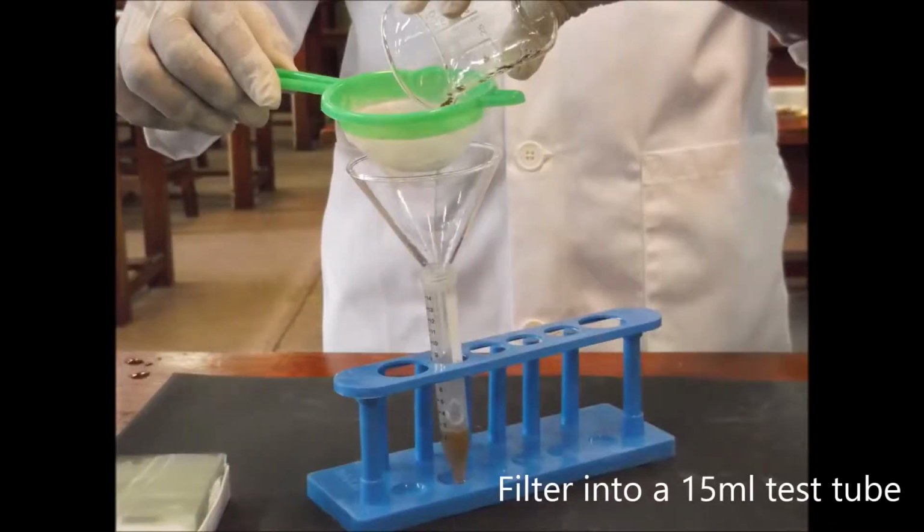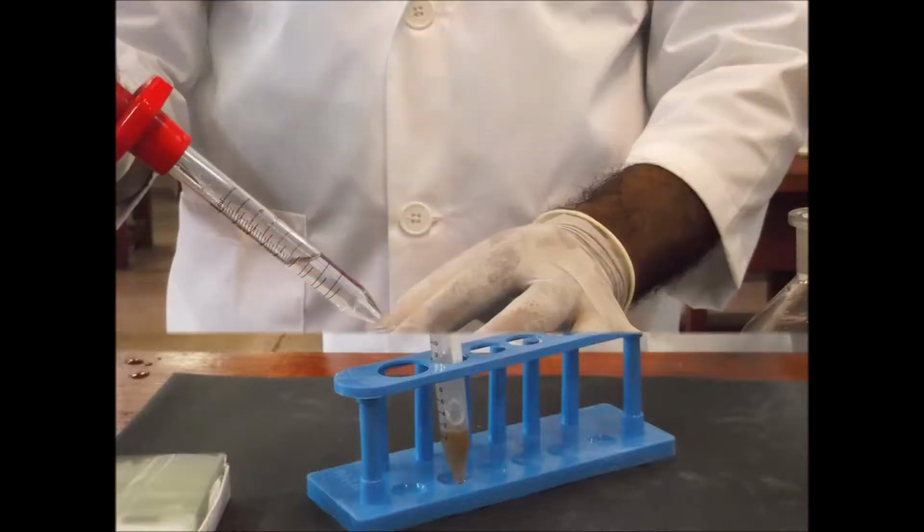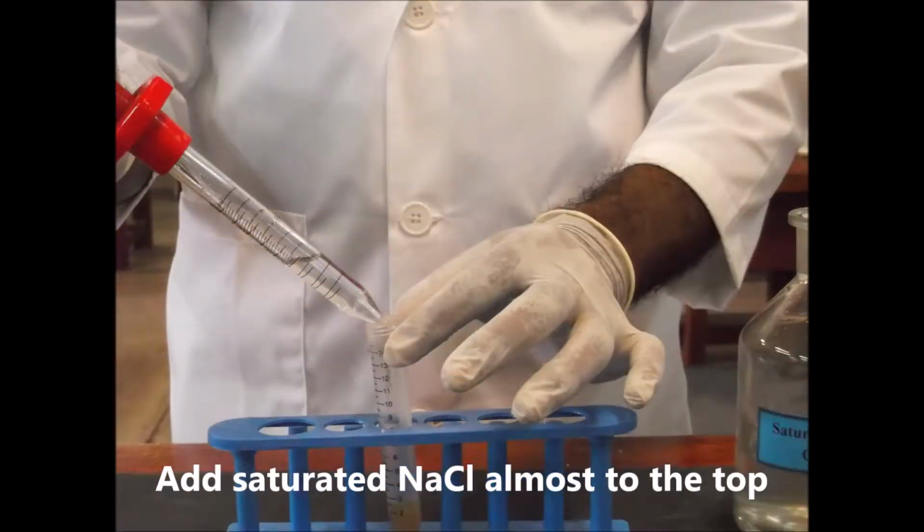Take a 15 ml tube and keep a funnel on it. Then take a wet strainer and filter the suspension through the strainer into the test tube. Now add some more saturated sodium chloride solution until the solution reaches almost to the top.